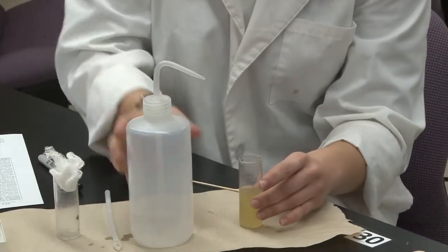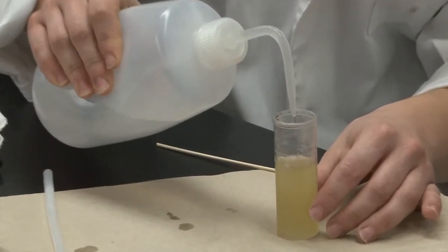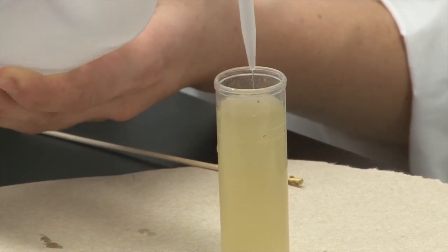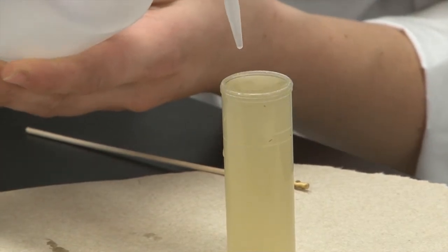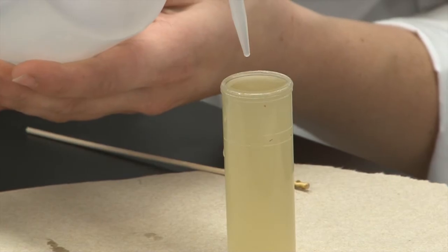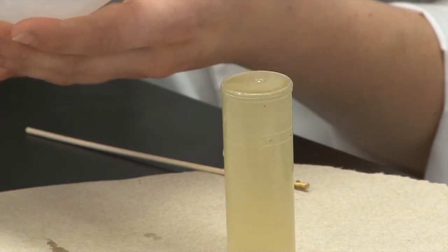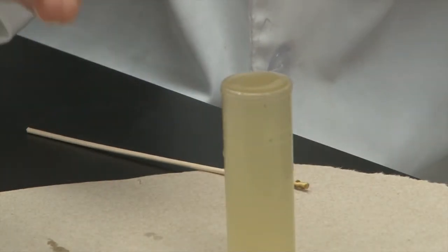With the second vial, you're going to fill it up with more flotation solution, all the way to the top until you form an inverted meniscus. An inverted meniscus is when you fill it up to where you think you're about to overfill it — like it's about to spill over — but just before that point, so you have this inverted kind of top of water.